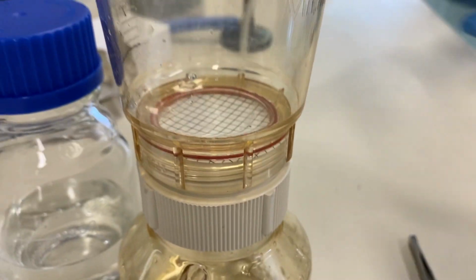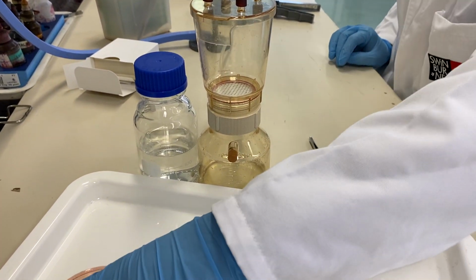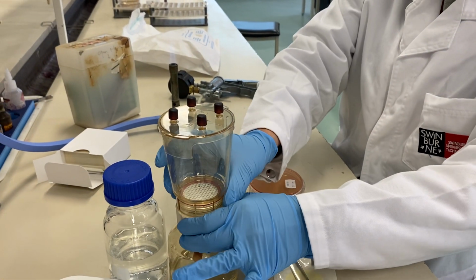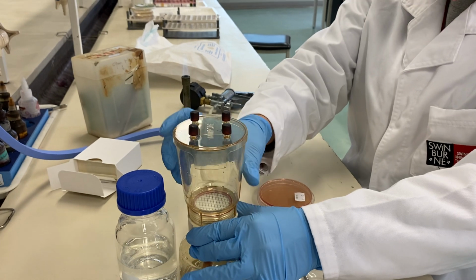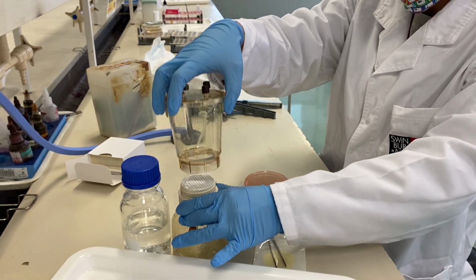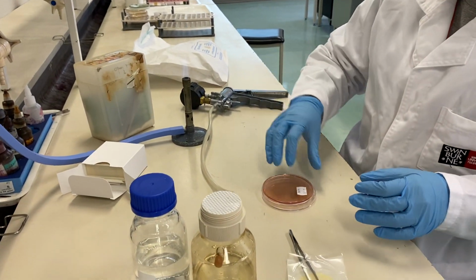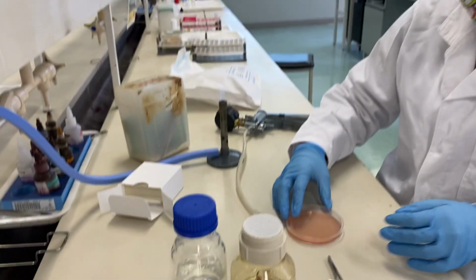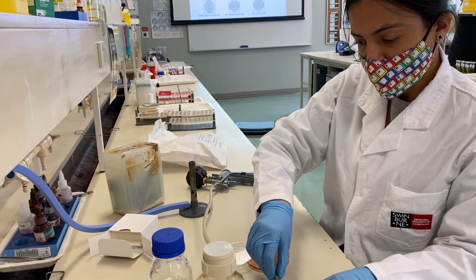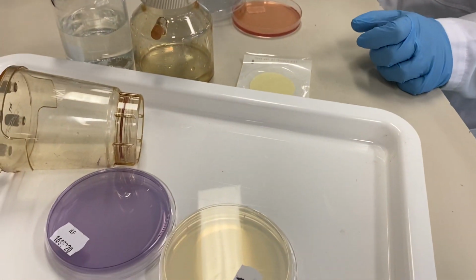I think it's done. Now the last part is, so we start with the endoplate. Yes. So we use the endoplate as the first plate, then we use the second batch of 50 ml of the water for the second plate, which is the KF, and then we use the last and third 50 ml of the water sample on PCA.